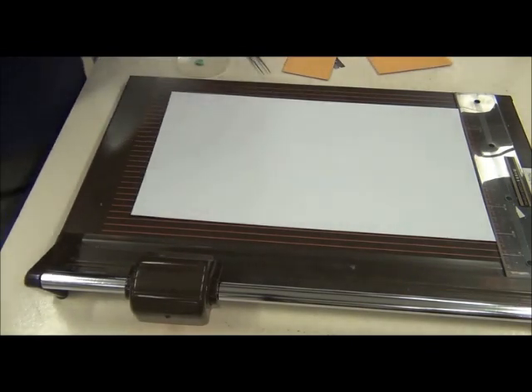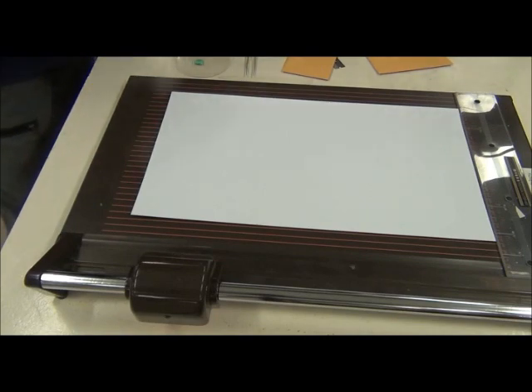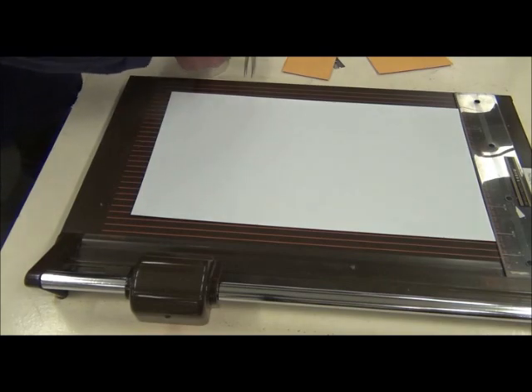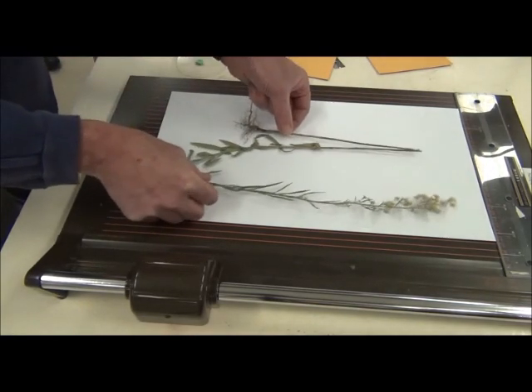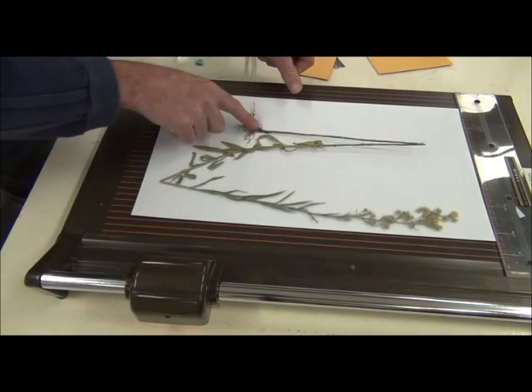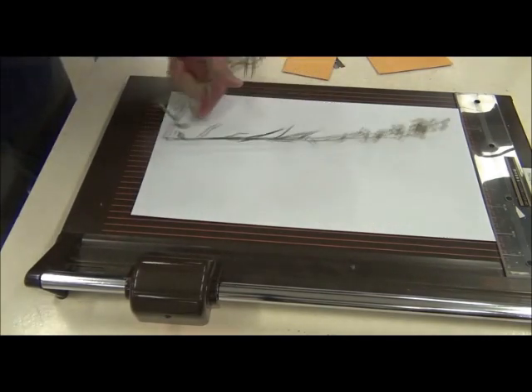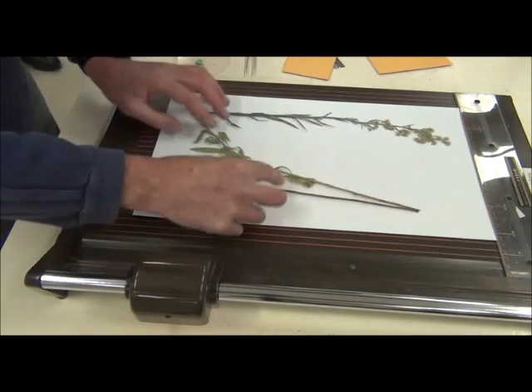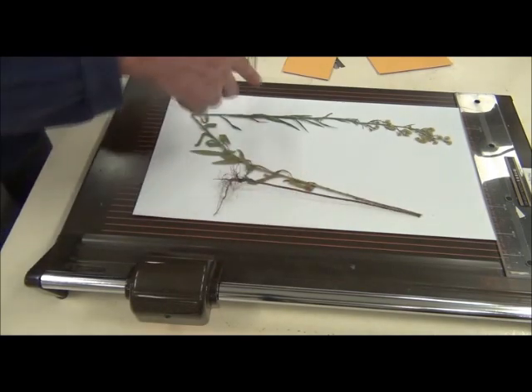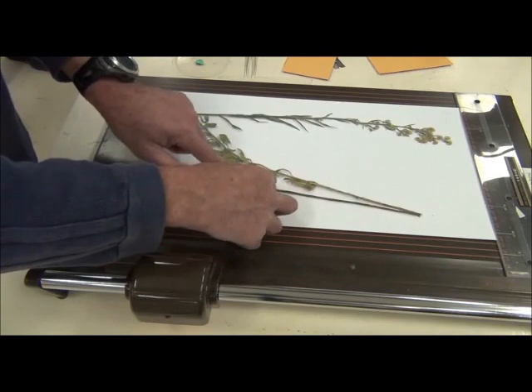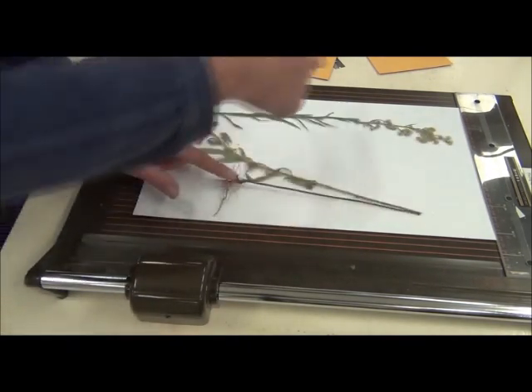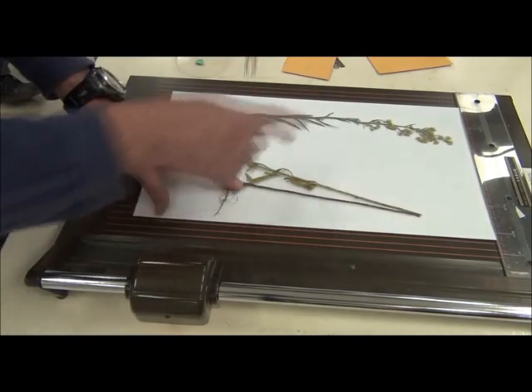So I have a specimen here, I've kindly, temporarily donated, very nicely pressed. In this case, you see it's actually pressed so that that's the side that's lying flatter, I think you can see. So rather than having it going left to right, in this case I'm going to go with the flow and go with the way it's pressed and put it base left to right.